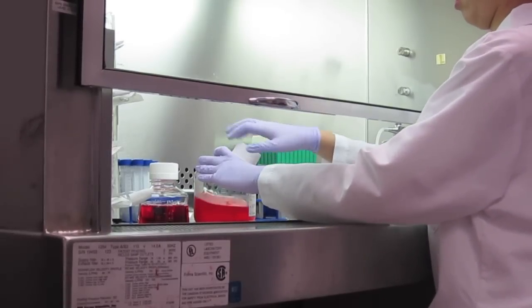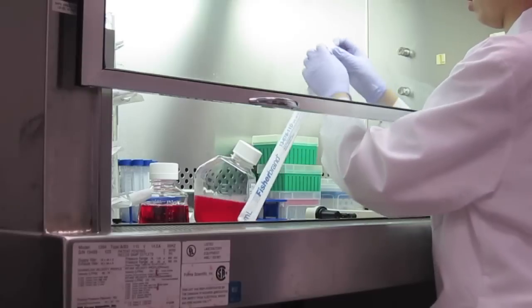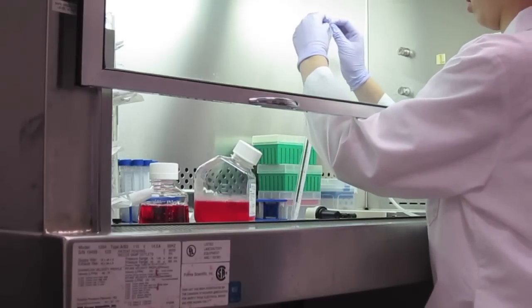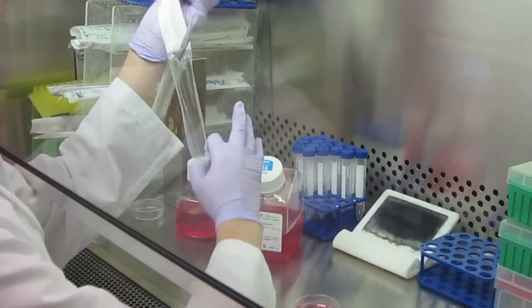Correct pipetting is important for maintaining sterile conditions. First, select the pipet volume appropriate for your task. Open the wrapping and peel down one quarter of the way.